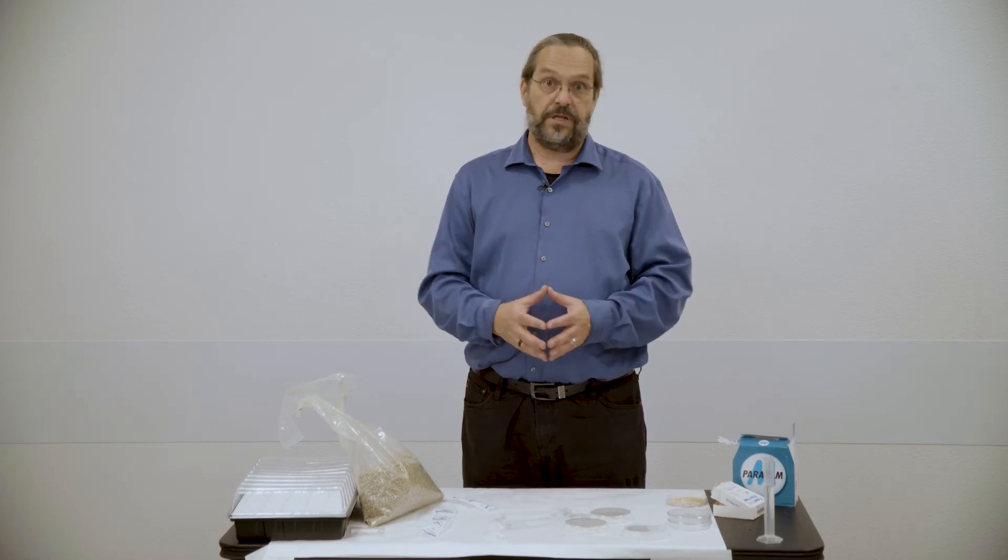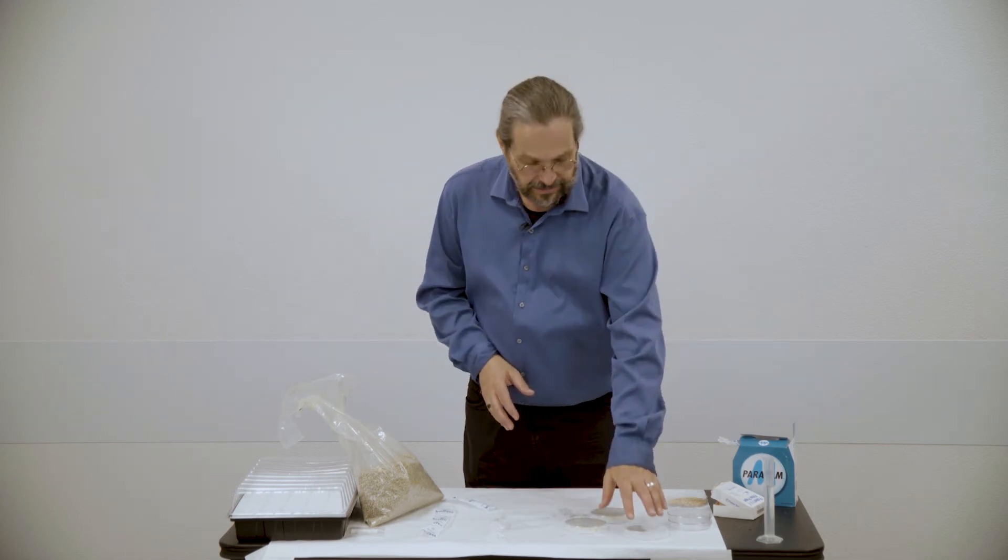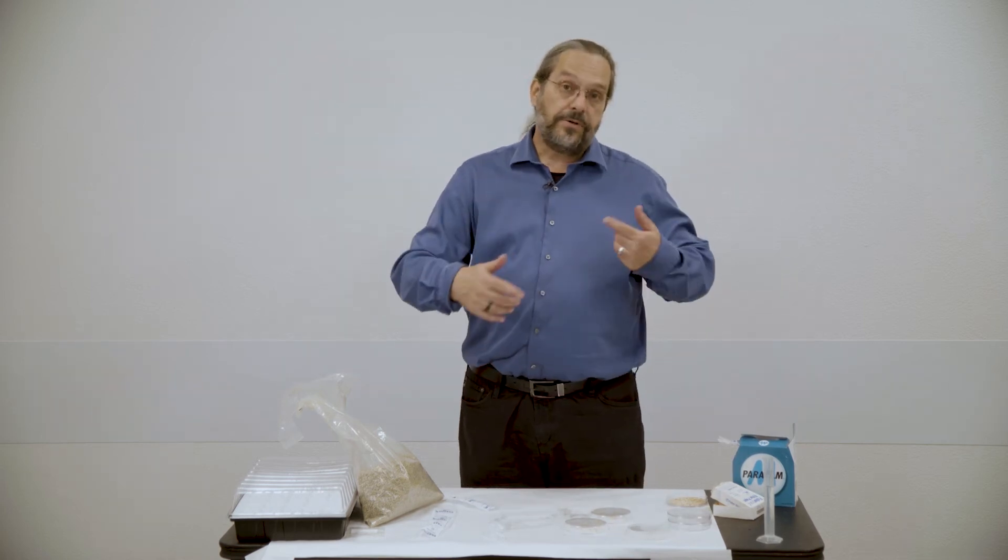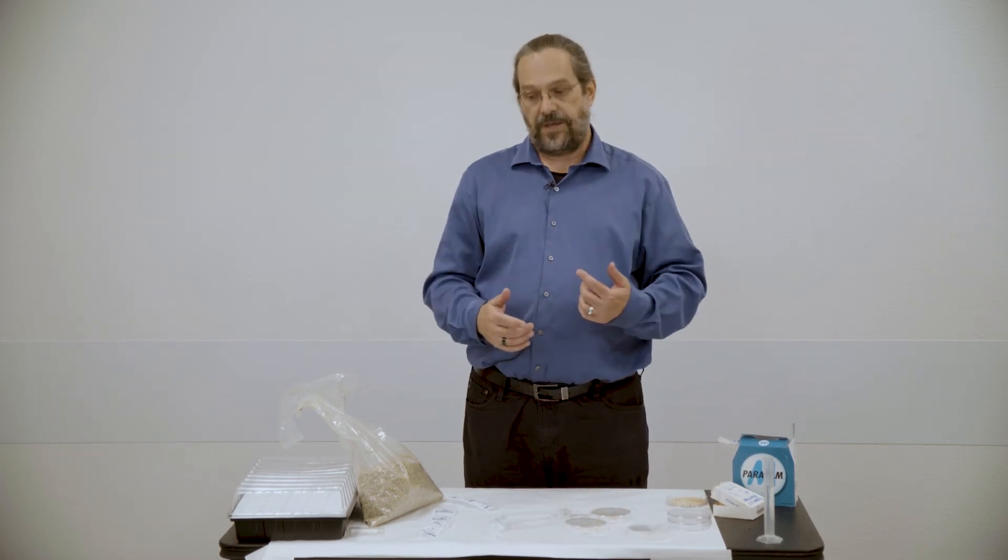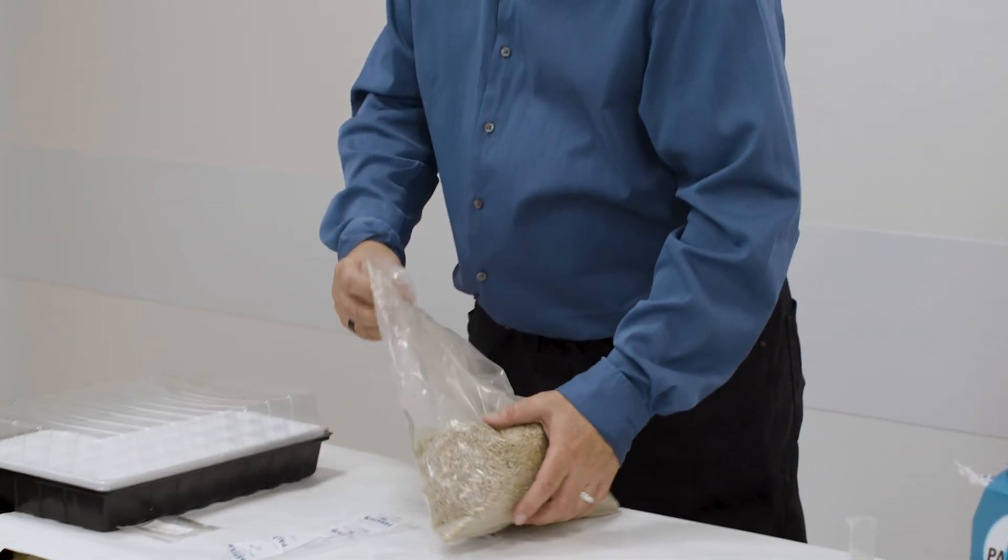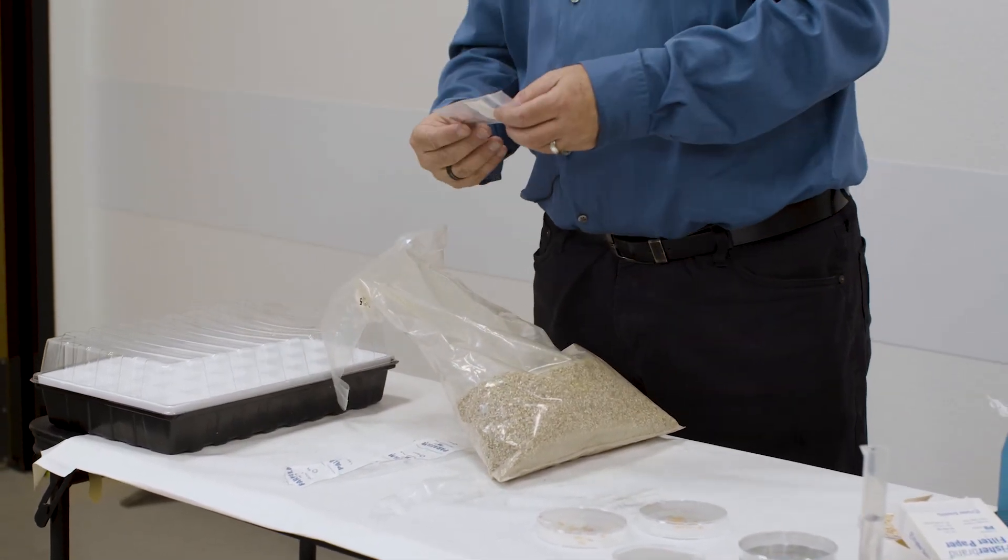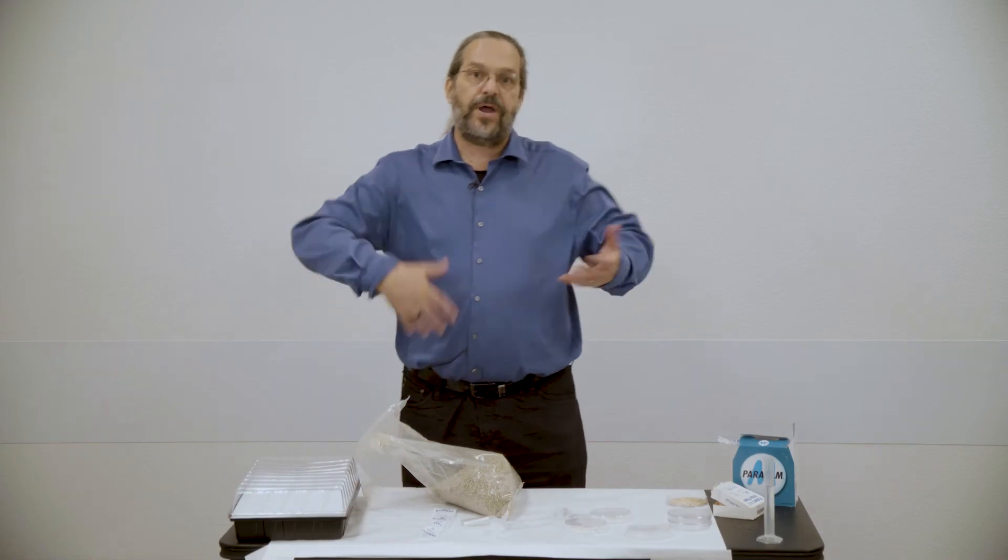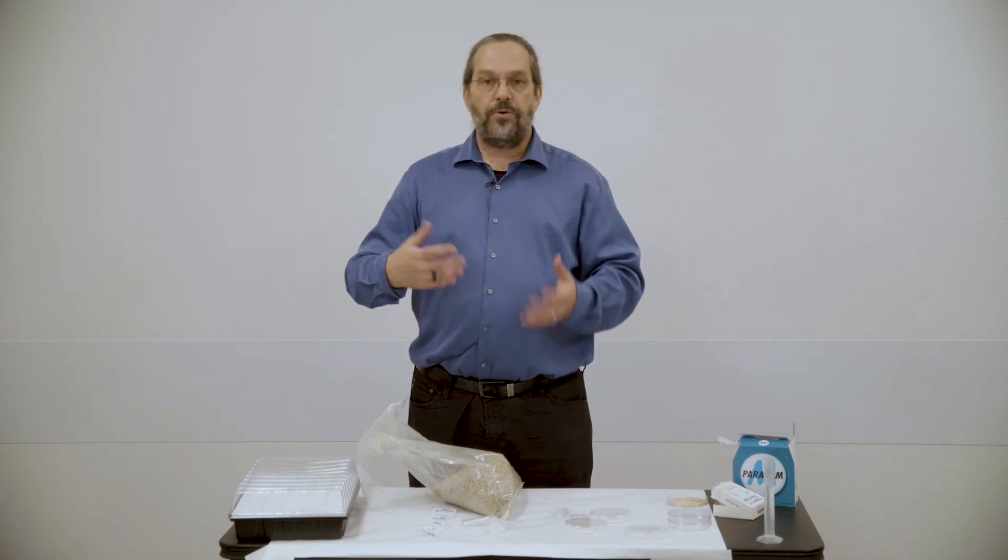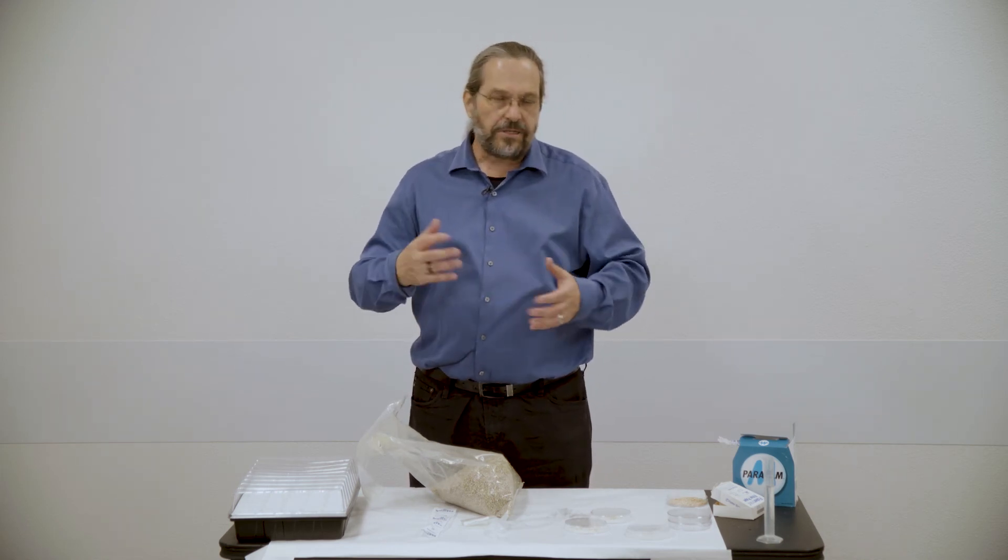So that's something that really gives you a little bit more of an option when you're looking at testing with seeds. Now, besides testing with seeds, a lot of your students are going to want to actually grow plants and grow those plants to do this kind of testing. So what I have here is parts from a kit sold by Wards for a plant called rapid radishes. And these rapid radishes have been selected to go through a life cycle in as little as 30 days.